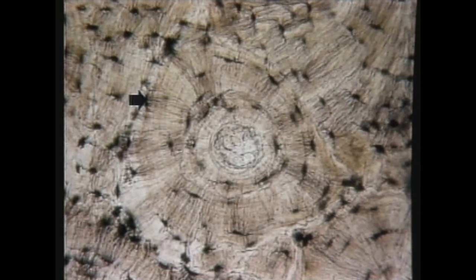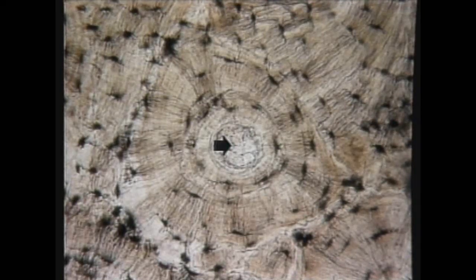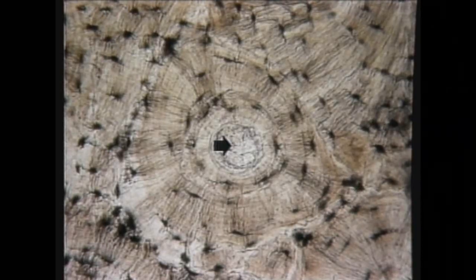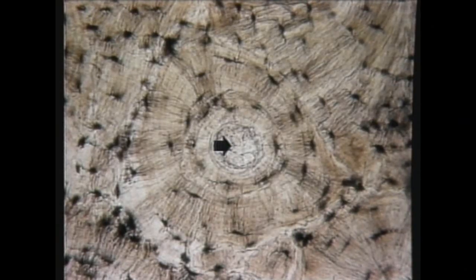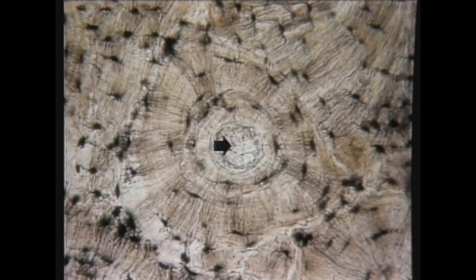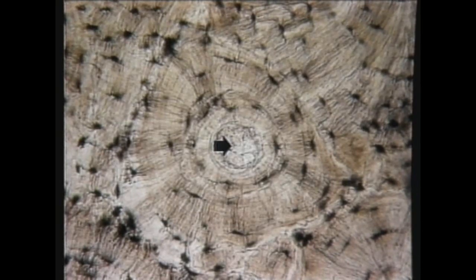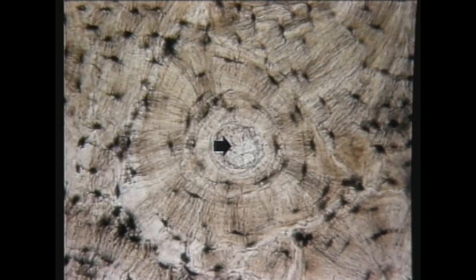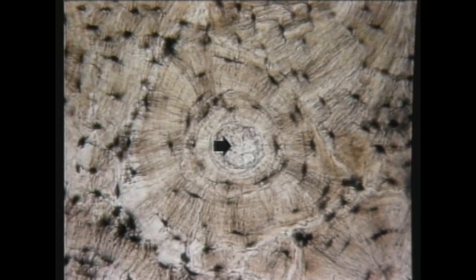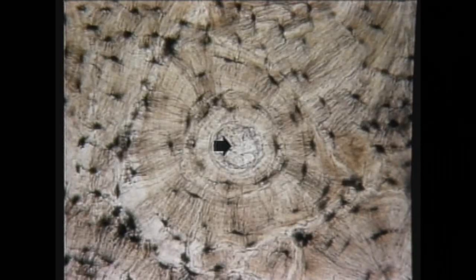Question number two. What is the name of the structure indicated by the arrow here? The answer is a Haversian canal. The arrow points to a Haversian canal, which is at the center of the Haversian system.